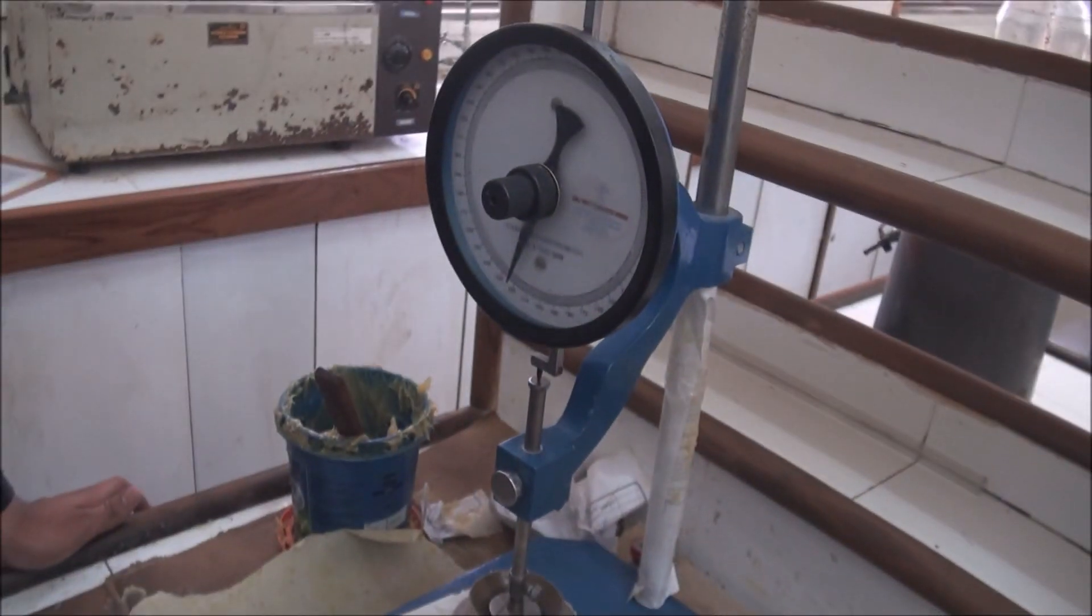Also, you can try this experiment for different types of grease and various brands of grease to find out which one is more consistent. Moving to flash and fire point.